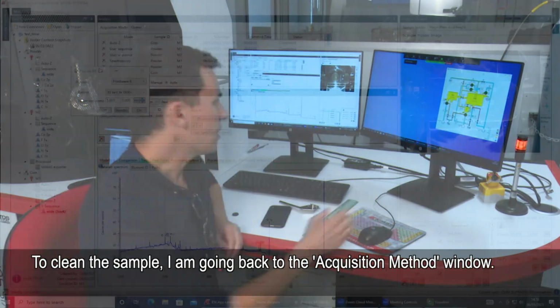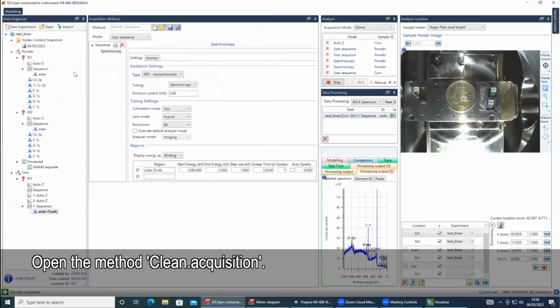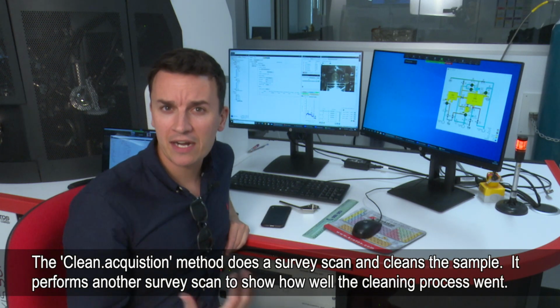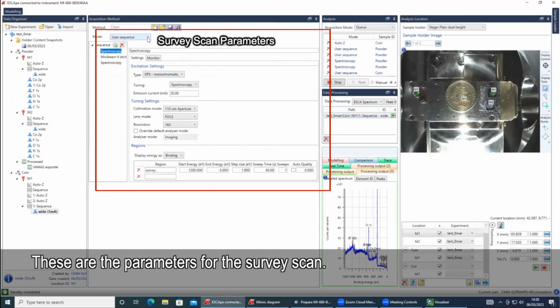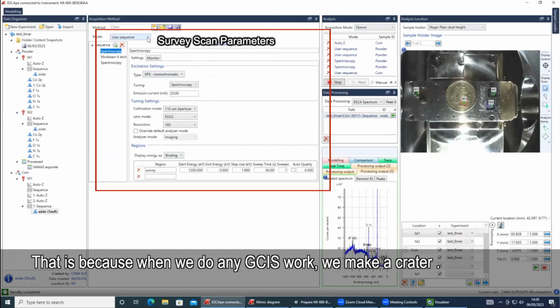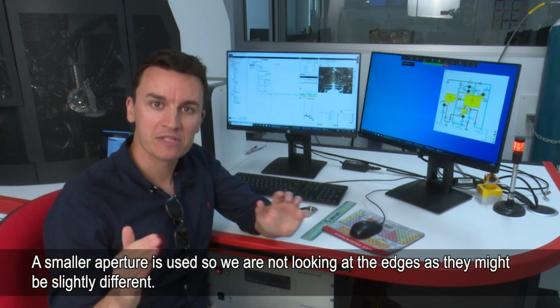To clean the sample, I'm just going to go back to the methods. I'm going to open a method called clean.acquisition. What this method does is a survey scan, it then cleans the sample, and it performs another survey scan to let us see how well the cleaning process has happened. These are the parameters for the survey scan. They're slightly different to the standard XPS parameters, because when we do any GCIS work, we make a crater. To ensure that all the data is from the middle of the crater, we need to use a smaller aperture, so we're not looking at the edges, because the edges might be slightly different.